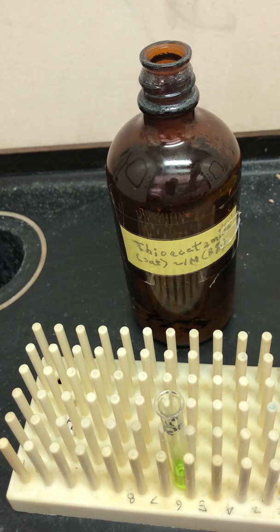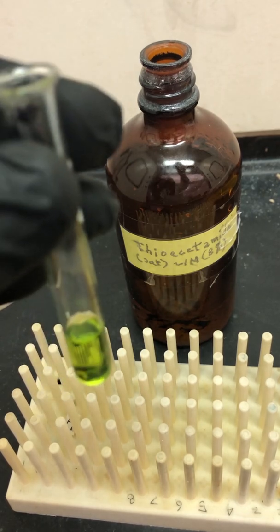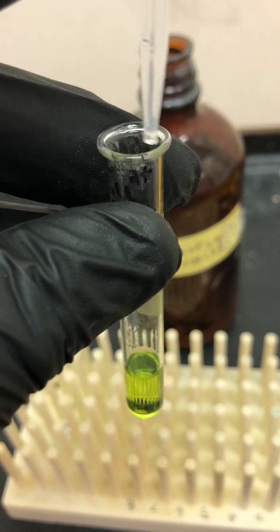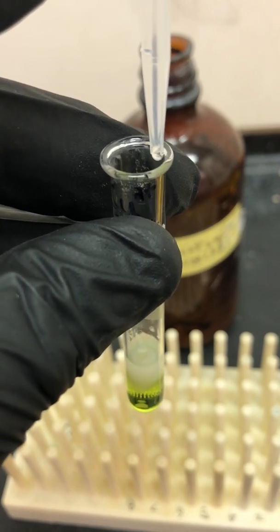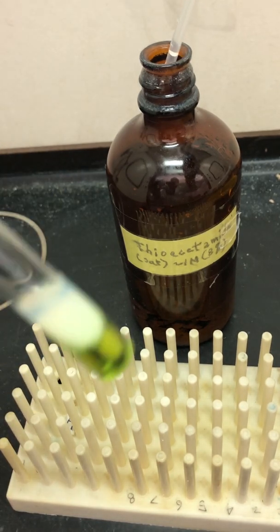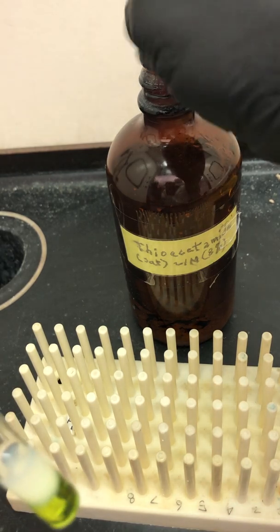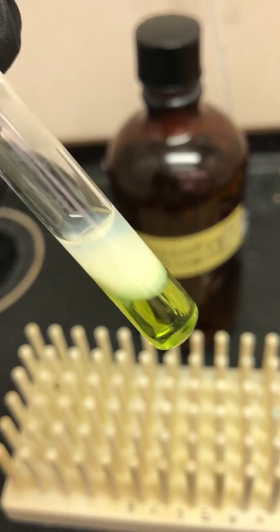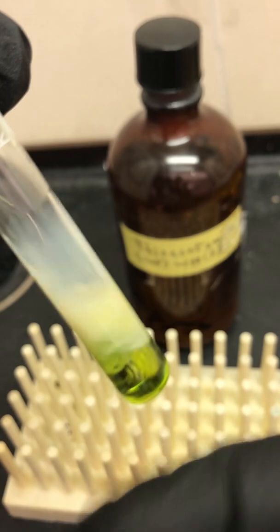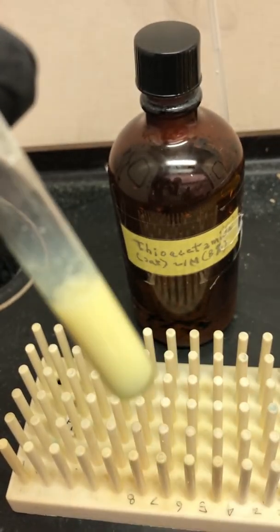I'm going to add 10 drops of thioacetamide to my mixture — 10 drops. You can see there's already a precipitate in there. However, that is not what I'm interested in. I want to make sure that what I've selected is specifically the copper II sulfide. So I'm going to swirl it with my finger here to mix it well, making sure that all of it is exposed to the chemicals.